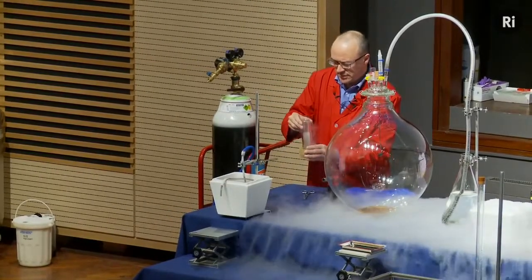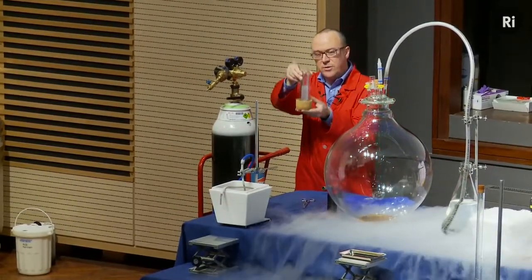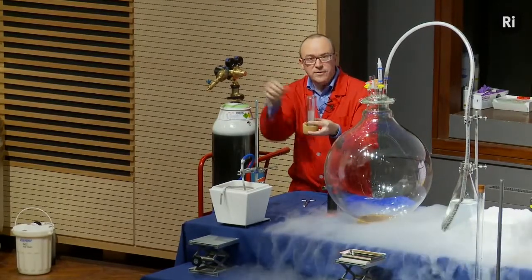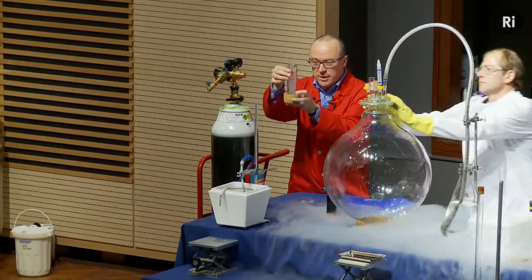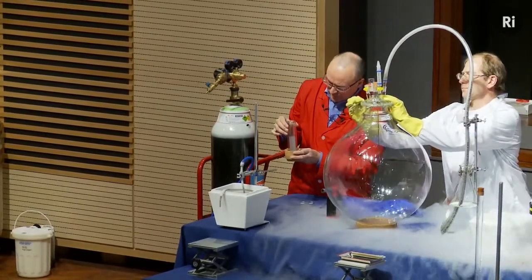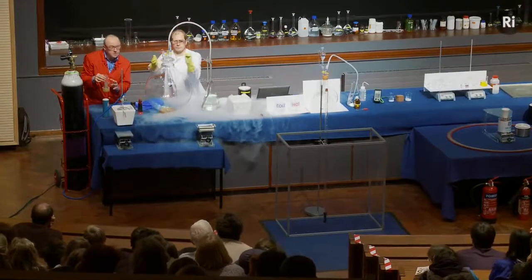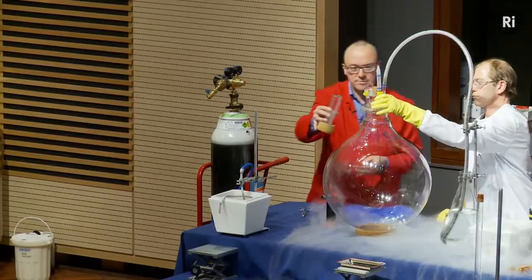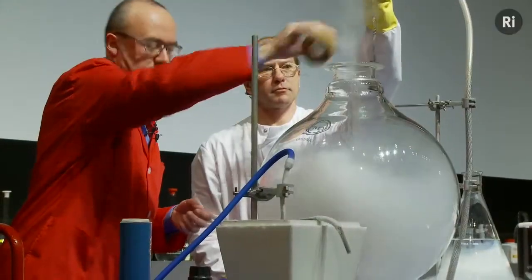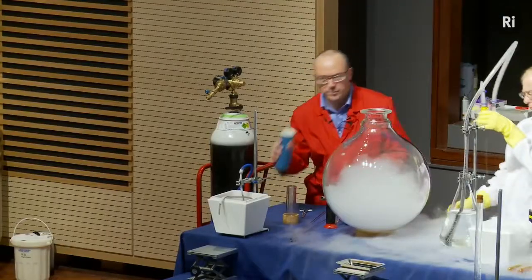And you may be able to see that although the air contains 1/5 oxygen, and the air of course is completely transparent, and yet oxygen, when it becomes a liquid, turns this lovely blue colour. Okay, so we're going to use this liquid oxygen then to fill this flask with oxygen. So I'm going to pour this in, and we'll add a bit more for good measure.